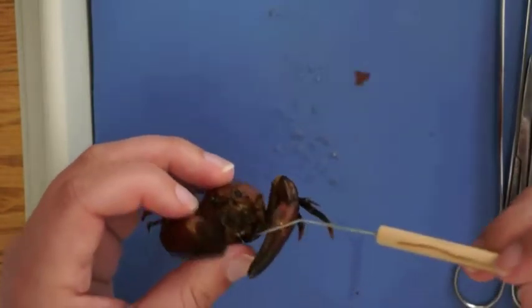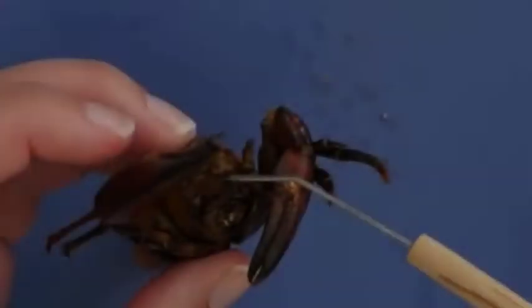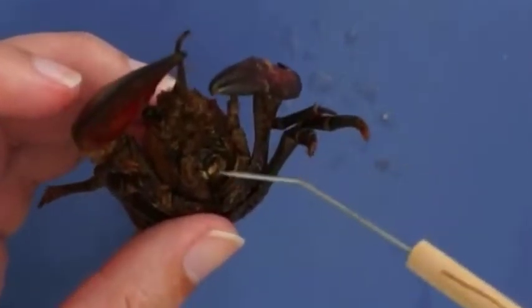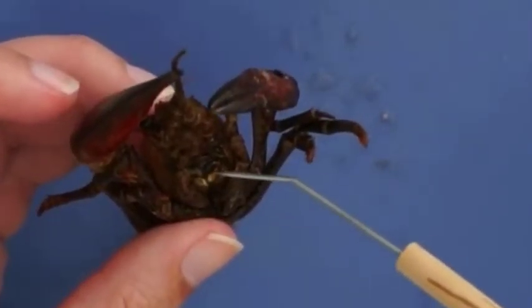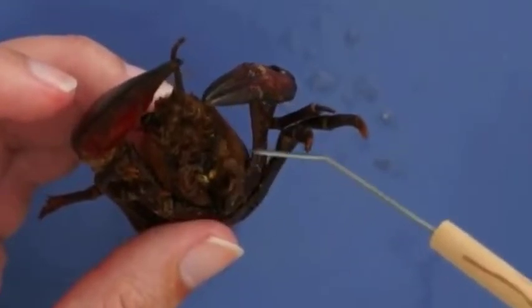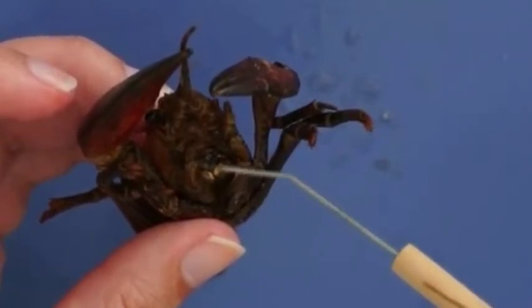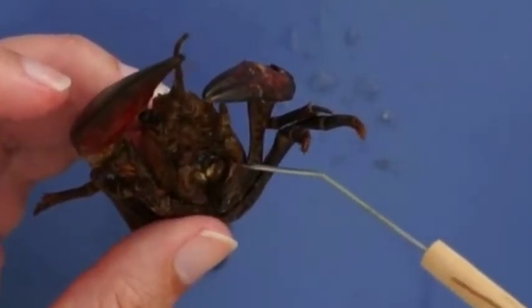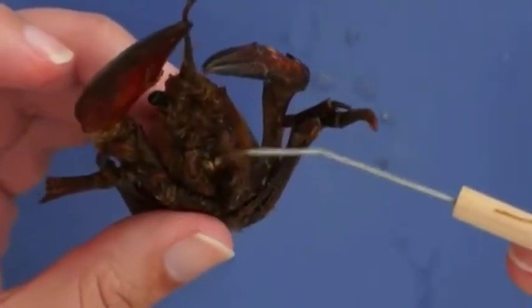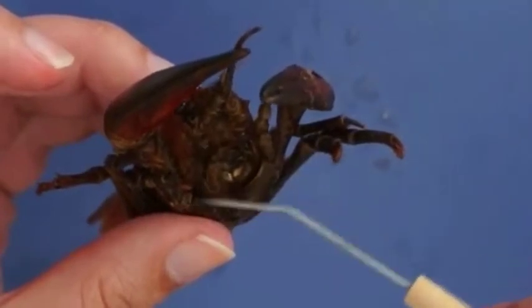We're going to look at some of the appendages here. You can see there are maxillae next to the mouth. And then mandibles are those light-colored structures — they're very hard and tough for crunching inside the mouth. And then there are maxillipeds, which are the longer structures right there, and those are for holding prey while they're eating.